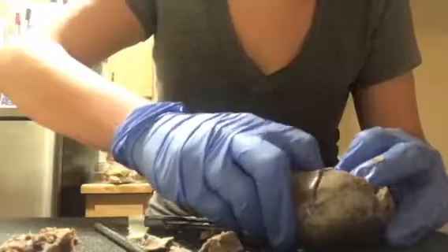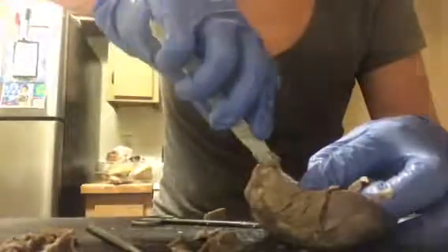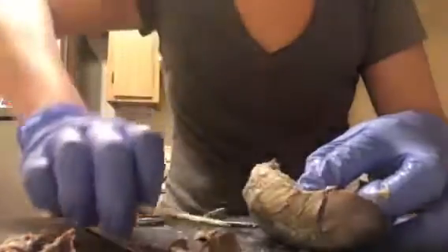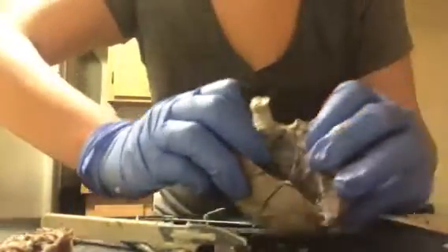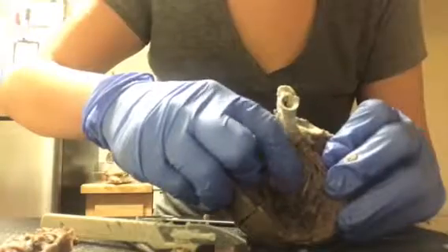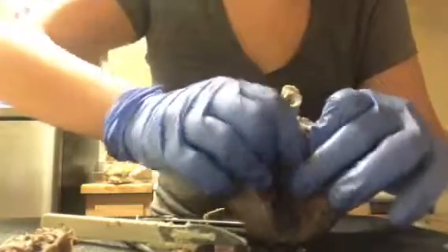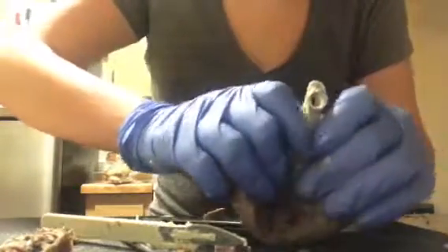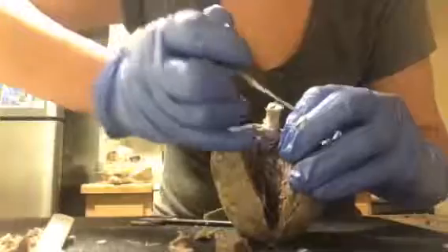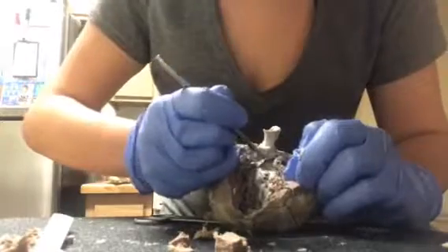By doing that, I'm not going to cut the muscles because I'll need them, but I'm just going to kind of get all this away, out of the way. That way I can point out the tricuspid valve, which would be right in this area. Right here. If you go right here, so the tricuspid valve would be right there.